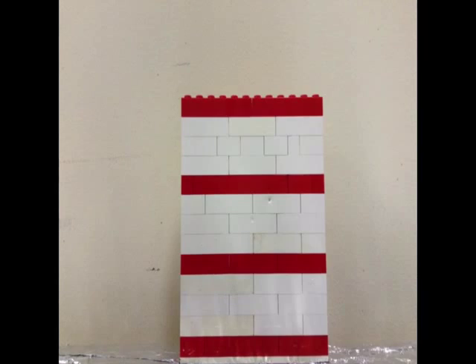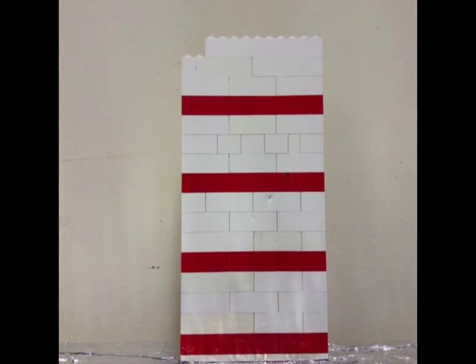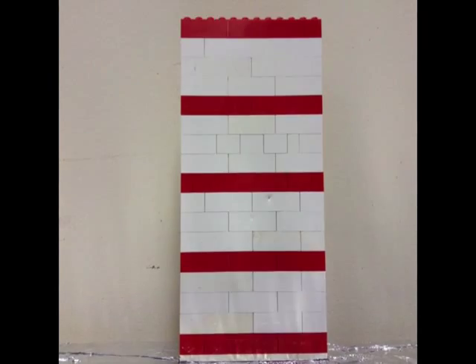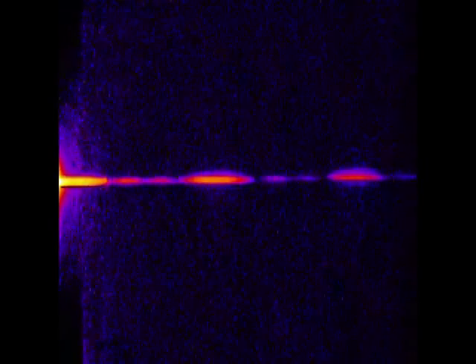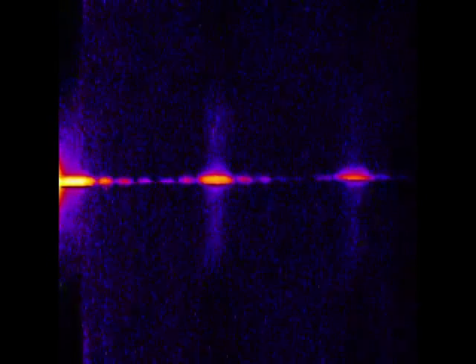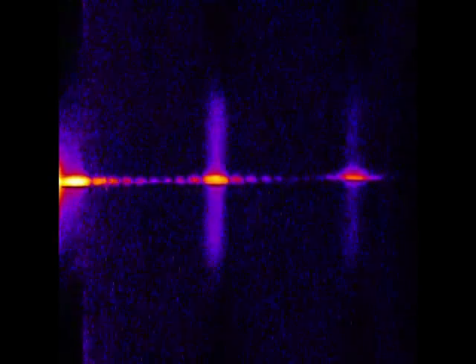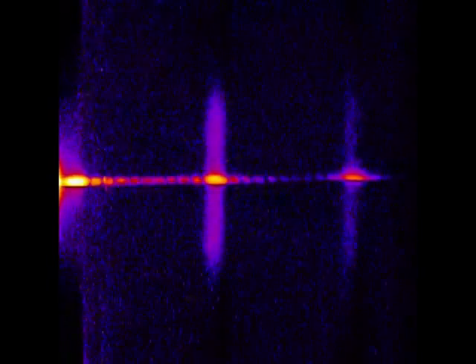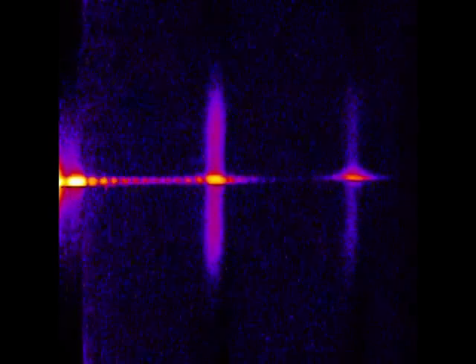This is like a super grating, or how we call it, a super lattice — that is what my research work is on. Here we can watch one of these super lattices grow layer by layer and see how the diffraction peaks evolve with time.